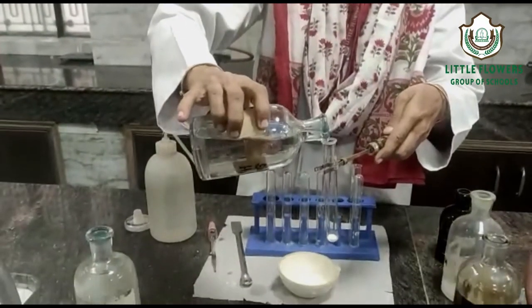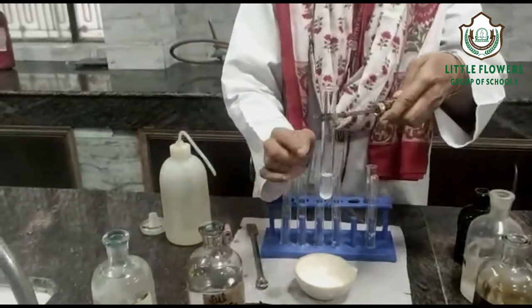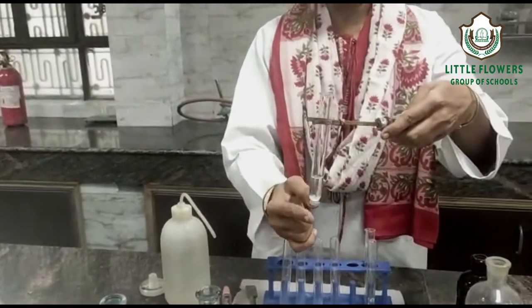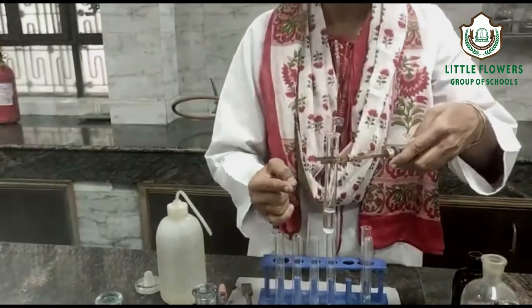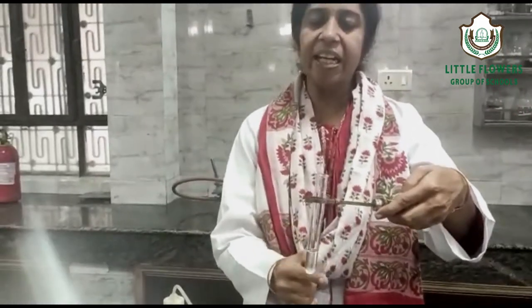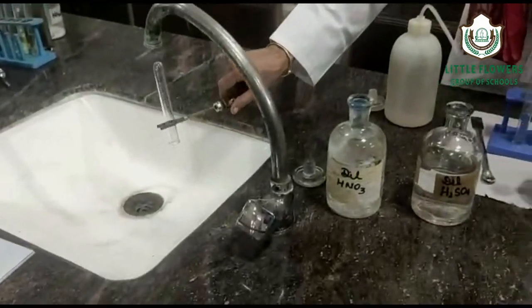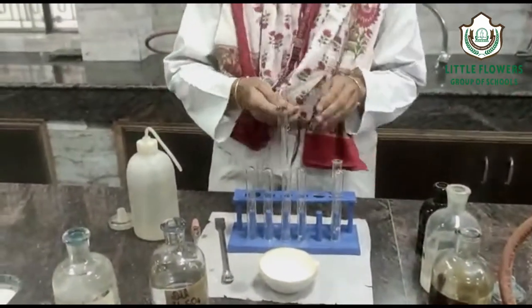Observe carefully — there is no reaction. No reaction means there is no brisk effervescence, which means the carbonate radical is absent. There is no rotten egg-like smell, which means the sulphide radical is also absent. Now we proceed for the concentrated sulphuric acid group.